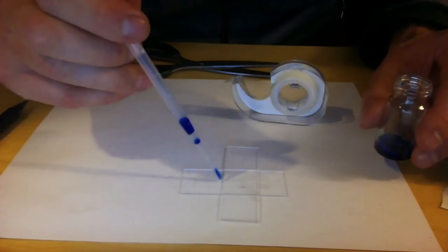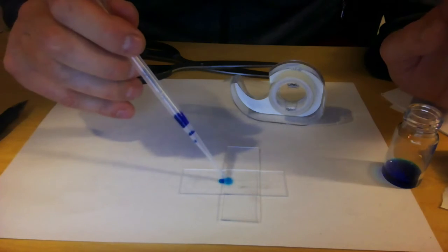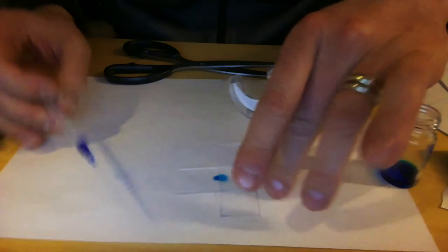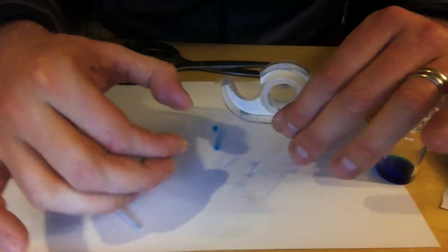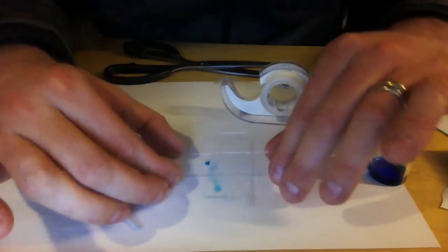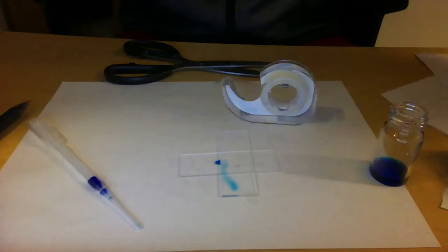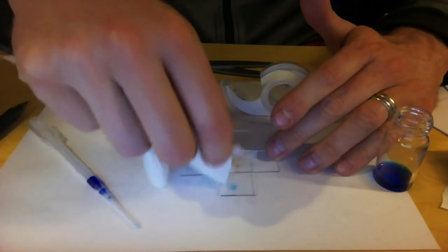So I'm going to take a little bit of blue dye and put that here. And if we're lucky, this is going to fill capillarily. But we don't see too much happening, unfortunately. So maybe this is again one of my famous failed experiments. I don't know. Nothing happens. Maybe if I add some liquid on the other side. Maybe the channel is a bit clogged on this side. I don't know. Let's see.